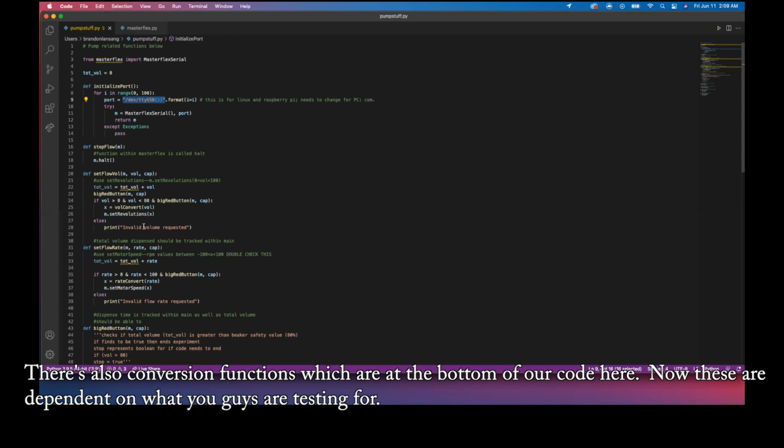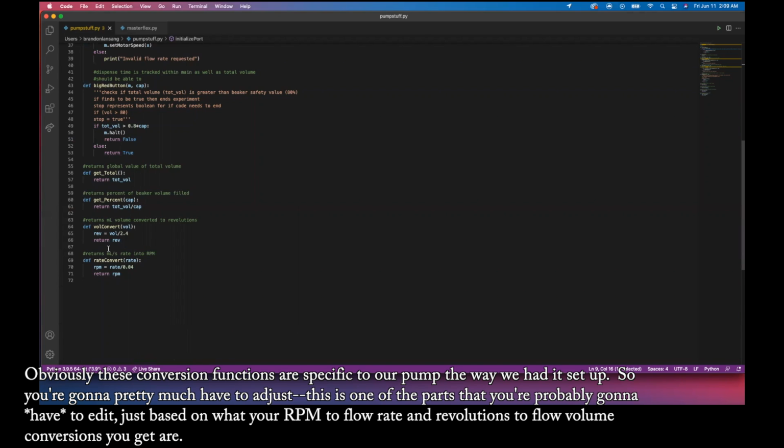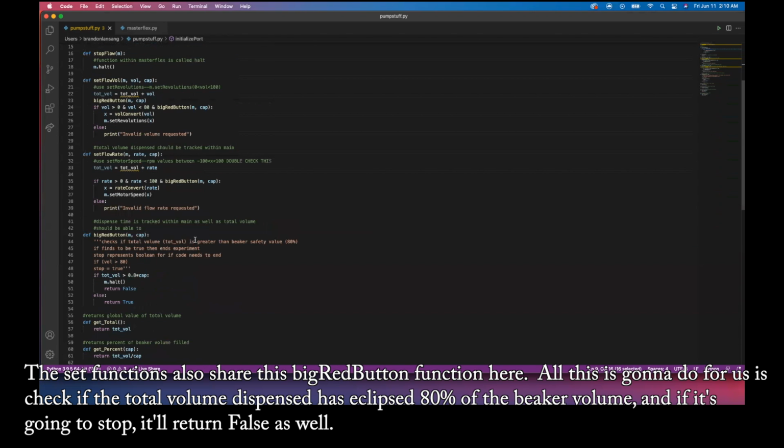There's also conversion functions, which are at the bottom of our code here. Now, these are dependent on what you guys are testing for. Obviously, these conversion functions are specific to our pump, the way we had it set up. So you're gonna pretty much have to adjust. This is one of the parts you're probably gonna have to edit, just based on what your RPM to flow rate and revolutions to flow volume conversions are. Now the set functions also share this big red button function here.